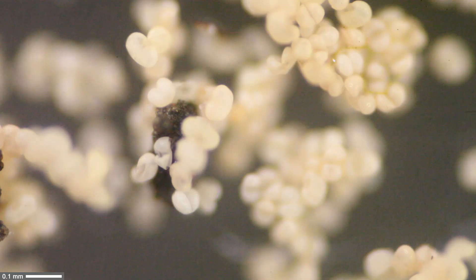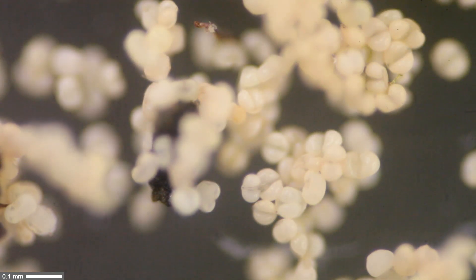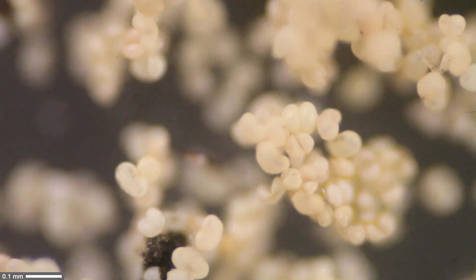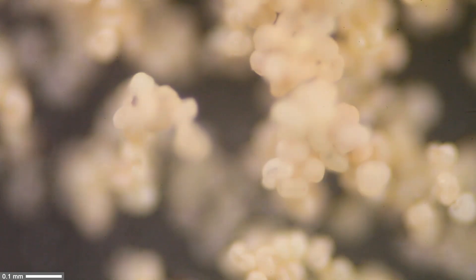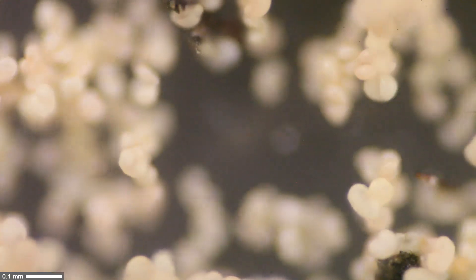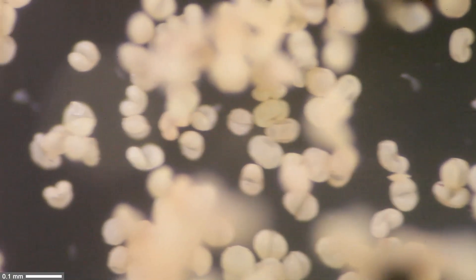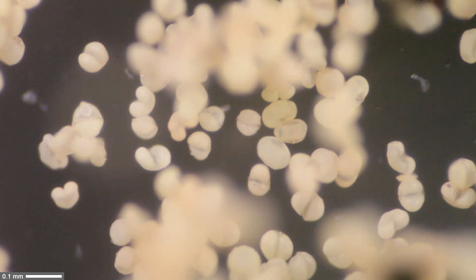The disadvantage with top illumination is that you can only use it with low power. At 10x it still works reasonably fine for focusing through different layers. At higher magnification the distance between the objective and slide is so small that the objective starts to cast a shadow, making it impossible for light to reach the specimen.